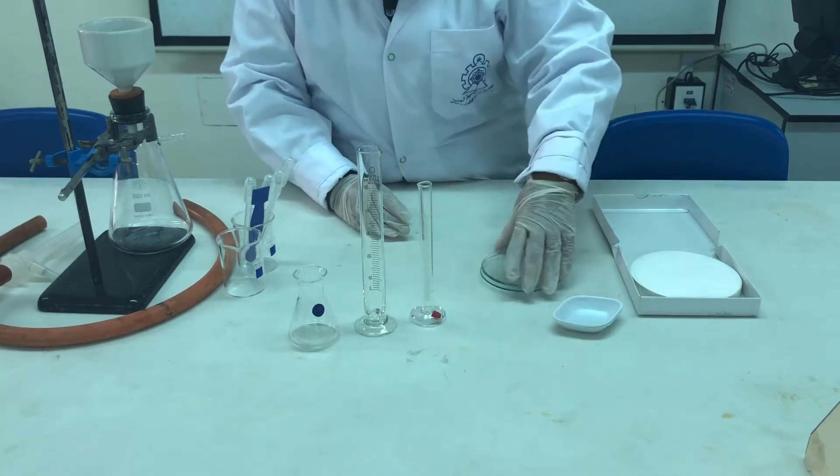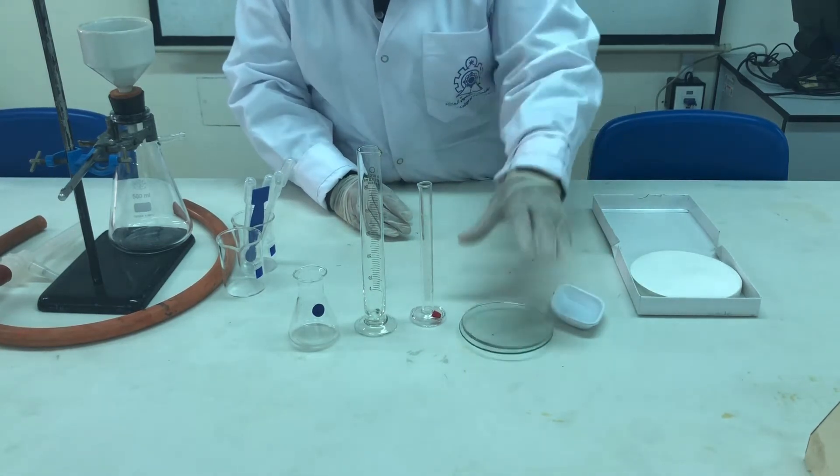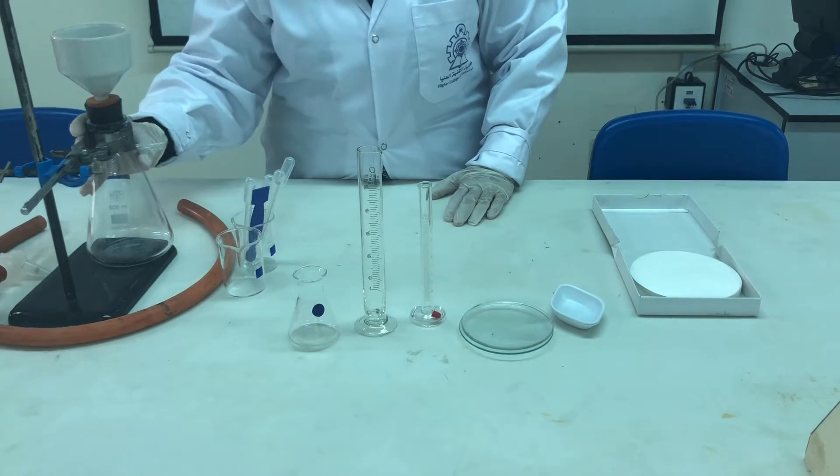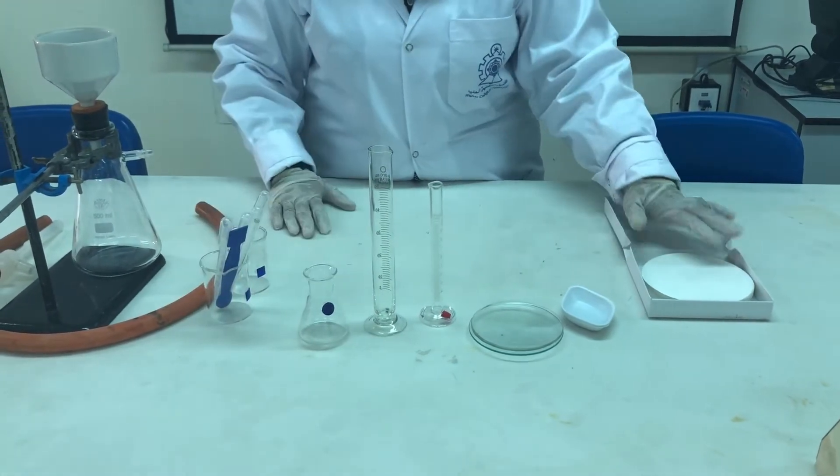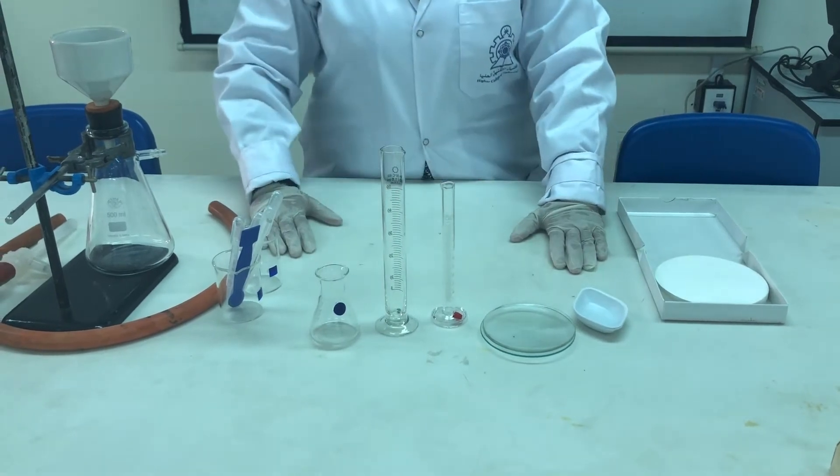This is the boat. This is the watch glasses. And this is the filtration apparatus. And these are the beakers and filter paper. So we are going to use all these apparatus.